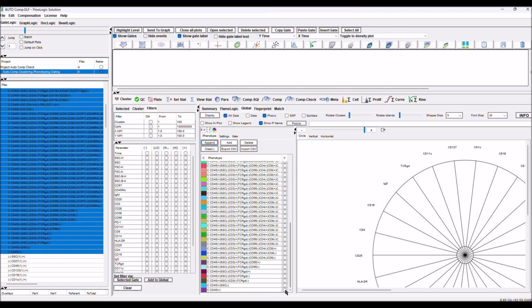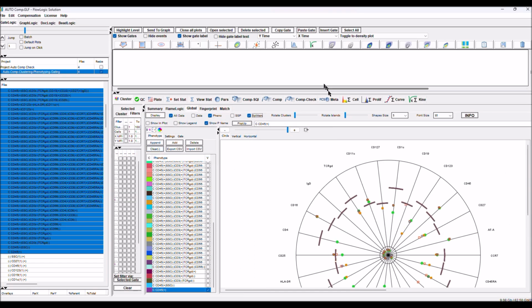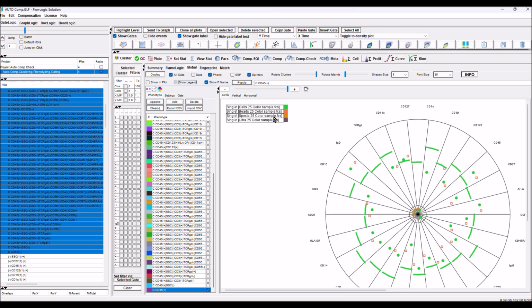So we can start with 45. You can see 45. We can have all our splitters. So this is the position of our splitter, and obviously this is done for all the clusters, for all the parameters, the files. We have 4 files, and here is the legend for the 4 files. We have the colors, we can see different colors, different shapes for all of them.